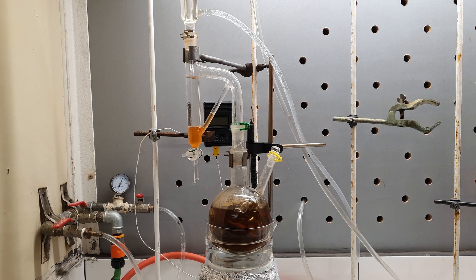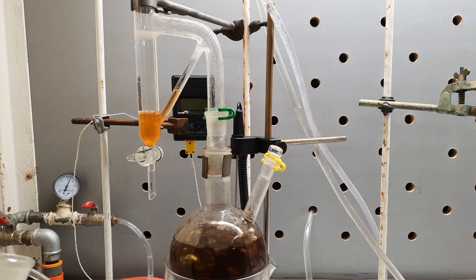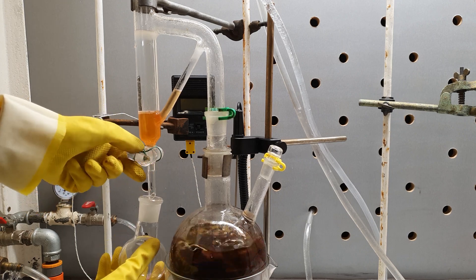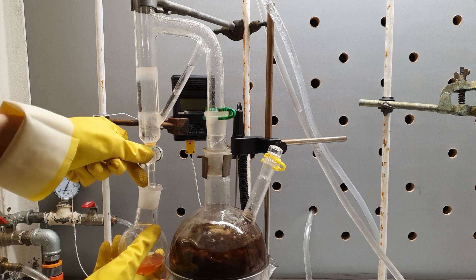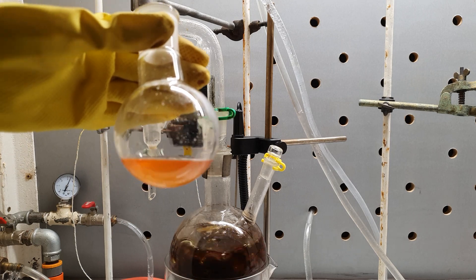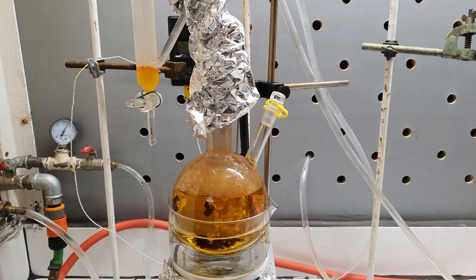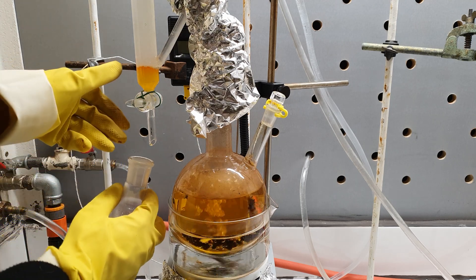Anyway, I transferred everything into another 1-liter flask and continued the distillation. You can see how the iodobenzene separates out in the Clevenger adapter, from where I can drain it at any time. This apparatus also returns the upper water layer back to the solution, so I don't need to worry that the flask will run dry. The distillation was continued until no more oily drops came off.